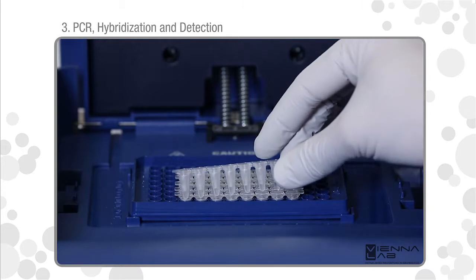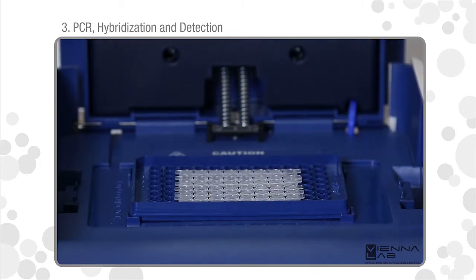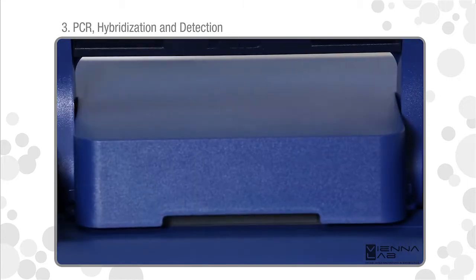Cap tubes tightly. Insert reaction tubes into the preheated thermocycler and run the appropriate program.